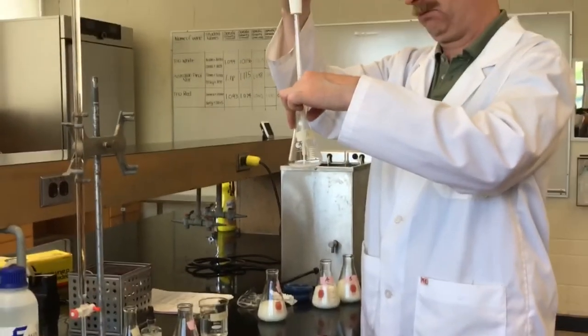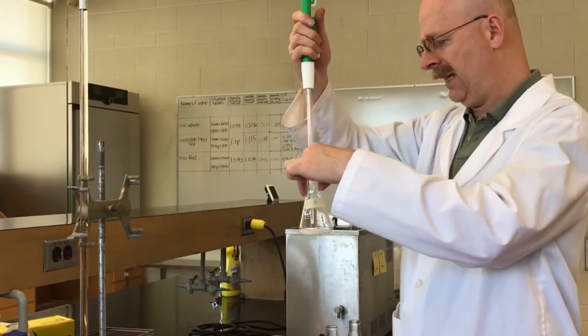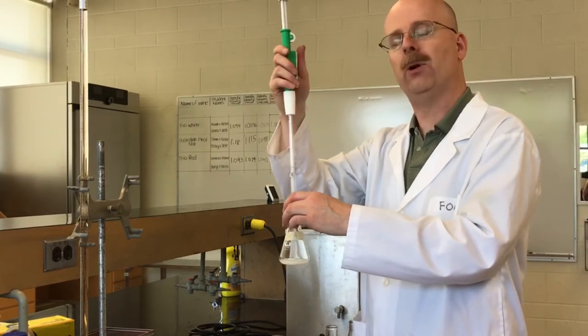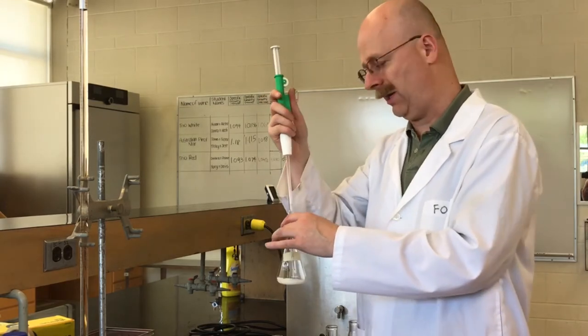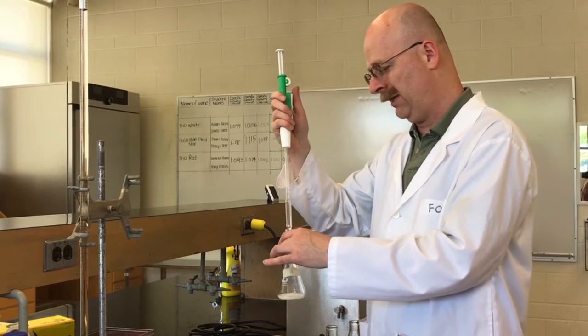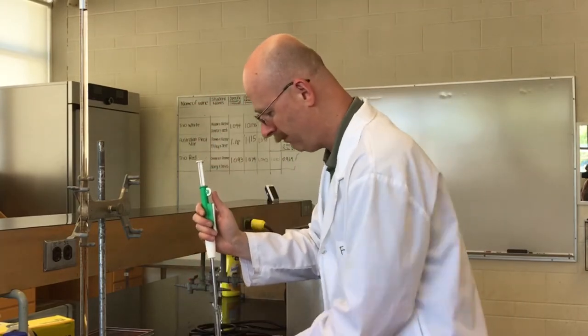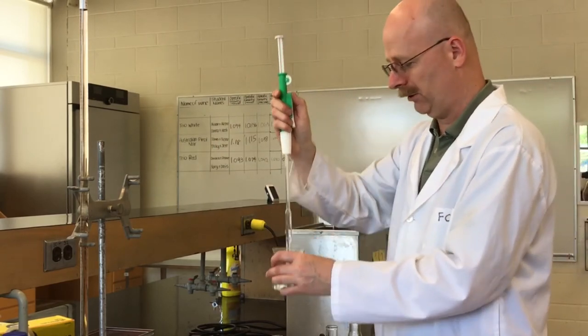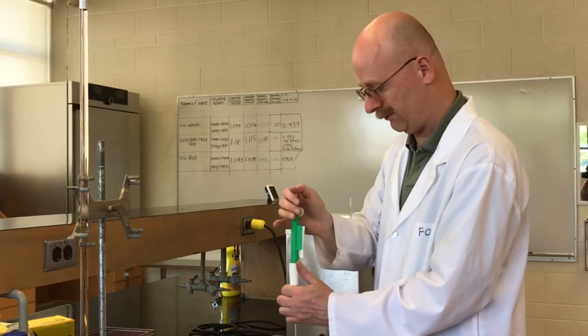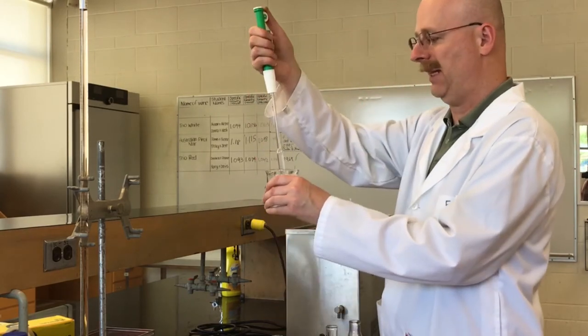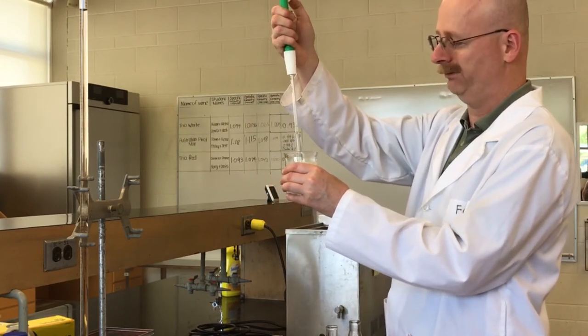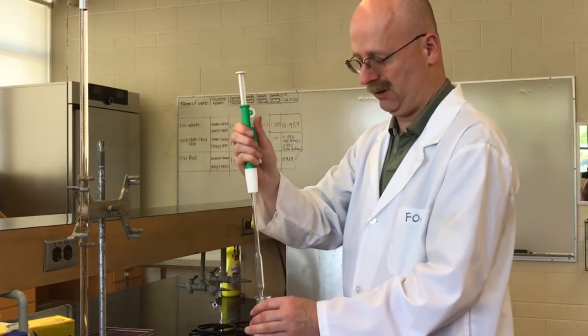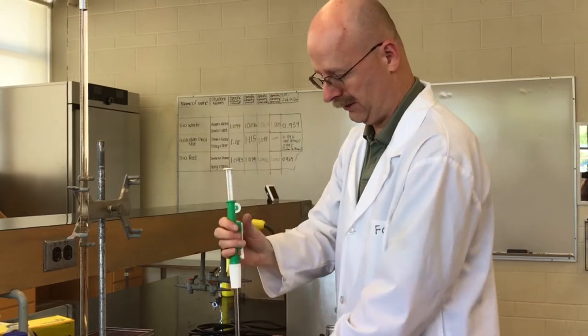I'm going to dispense it, and then the next thing we're going to do is we're going to add some distilled water. It's asked us to put about an equal amount of distilled water. The quantity doesn't have to be precise; it's not a critical amount. In fact, I'm just going to use the same pipette. The volume of the milk is what's critical, not the volume of the distilled water. Distilled water just allows us to see things a little bit easier because we're going to be looking for a color change. So just adding approximately nine mils of distilled water.